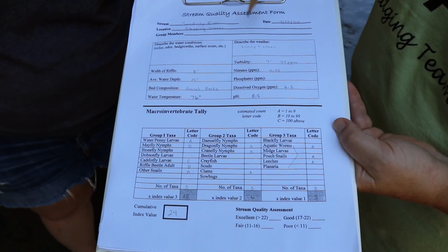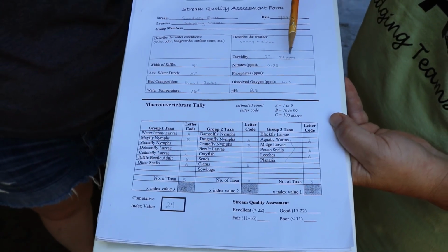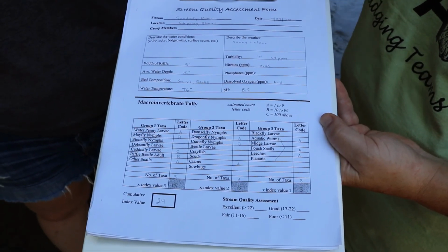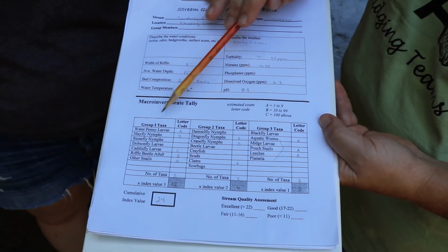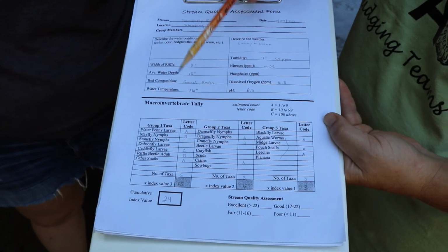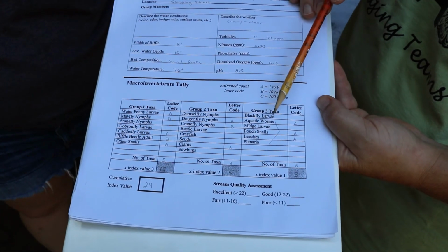And so as you take a look in here, we have our turbidity that we've measured, our nitrates, our dissolved oxygen, and our pH. If you look at some of these numbers, some of them are not the greatest, dissolved oxygen being one that's not real good. And turbidity, because of the rain, is not great right now. But then if we go down here and we look at our macroinvertebrates, the way we score these, we have our group 1s, 2s, and 3s. Group 1s are going to be worth a value of 3 points each because they're only found in good water quality. Group 2 get a value of 2 points each, and Group 3 a value of 1 because they can live wherever. It doesn't really matter what the water is.